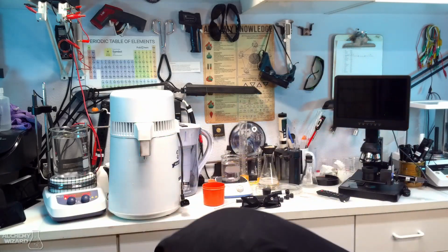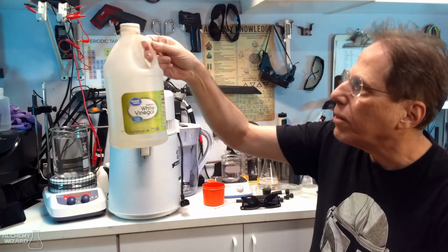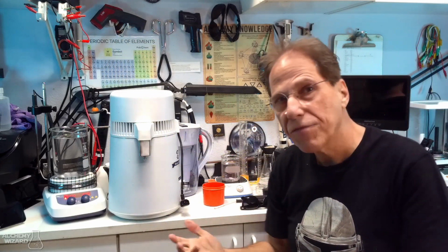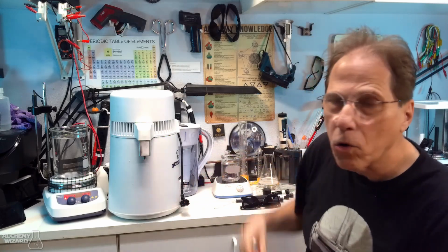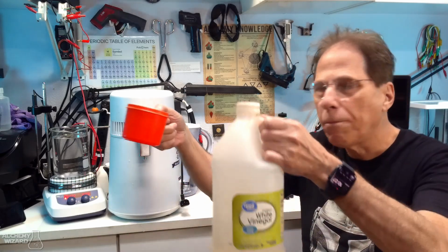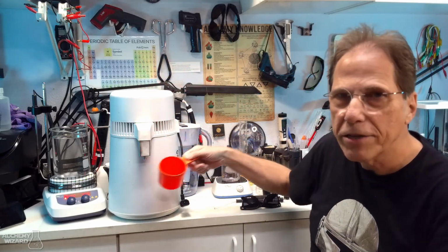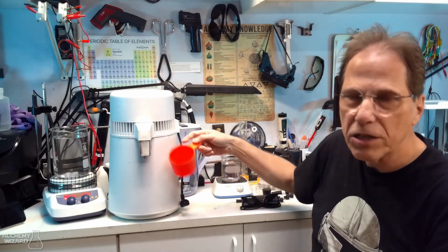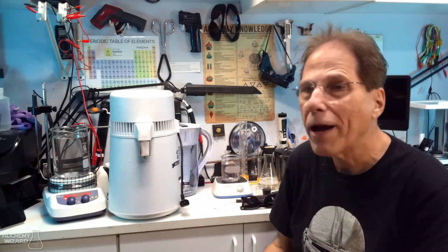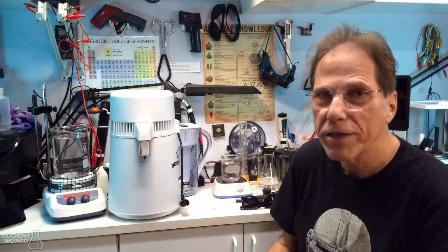You're going to need white vinegar. White vinegar is relatively inexpensive. Now, what I usually do when I have to clean it is what I call the mild way of cleaning it. I will use a cup, put a cup of white vinegar in here, and dump it into the distiller. Then fill the distiller up to the water mark, and then let that cook for about 2 hours, 2.5 hours. Don't want to let it cook all the way to the end.